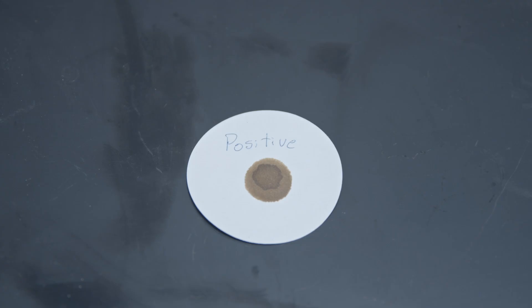A drop that forms a darker solid or annular nucleus with a brown or yellowish brown circular stain should be reported as positive. For a drop that forms a uniformly brown circular stain, use the following procedure.